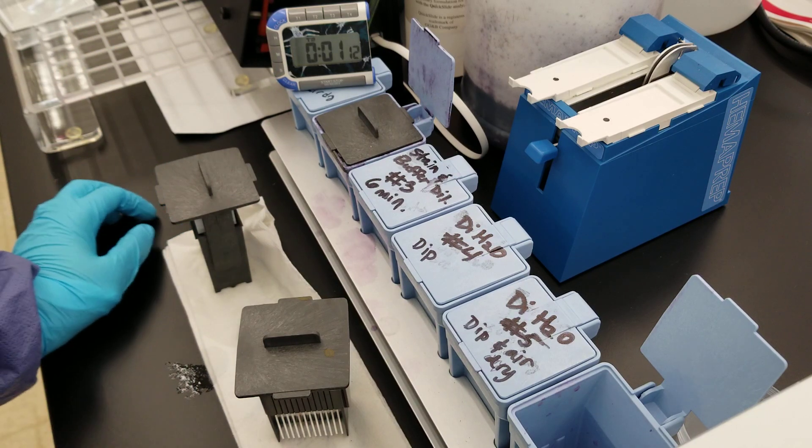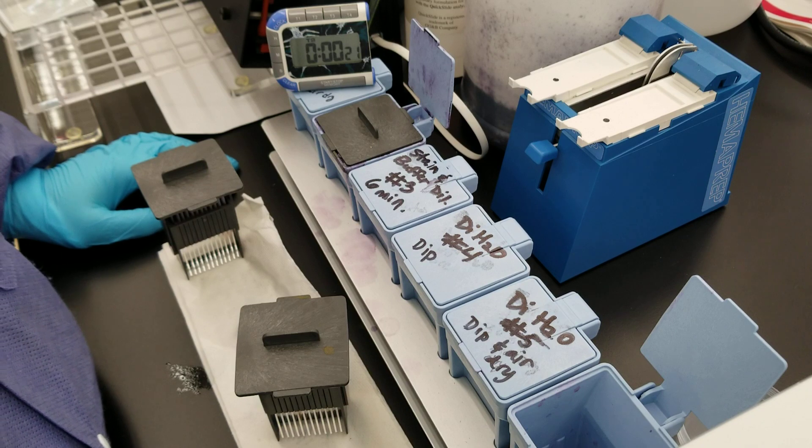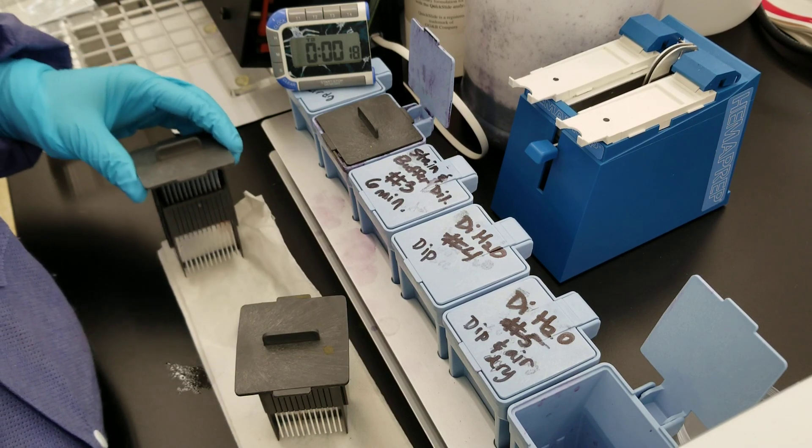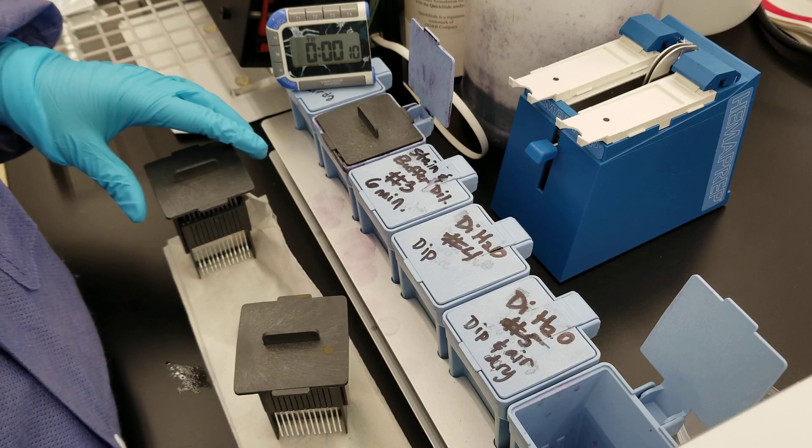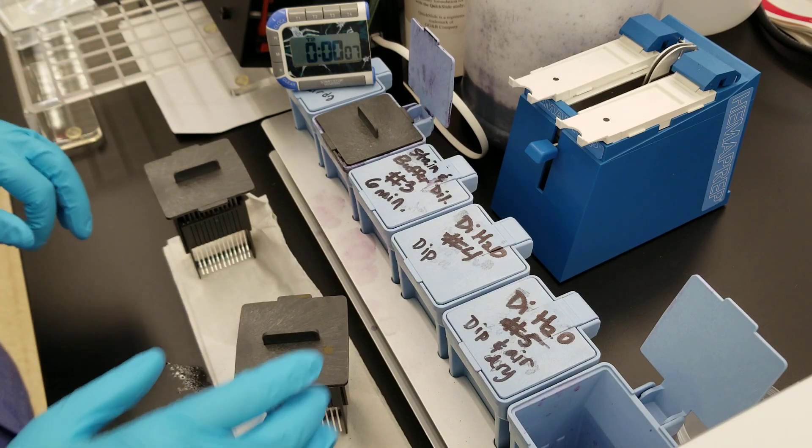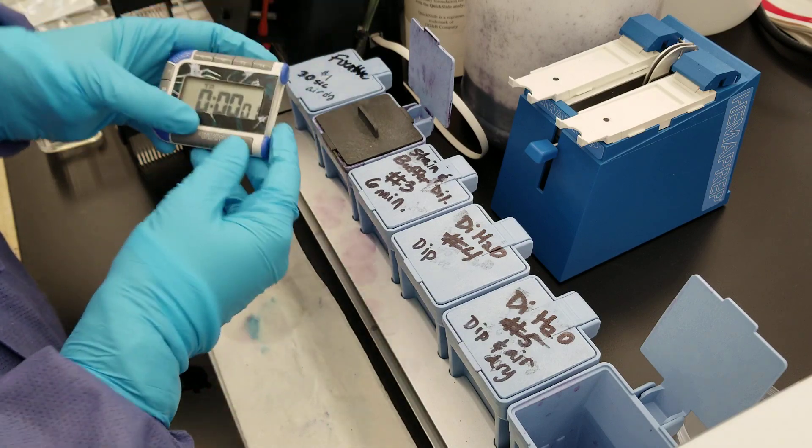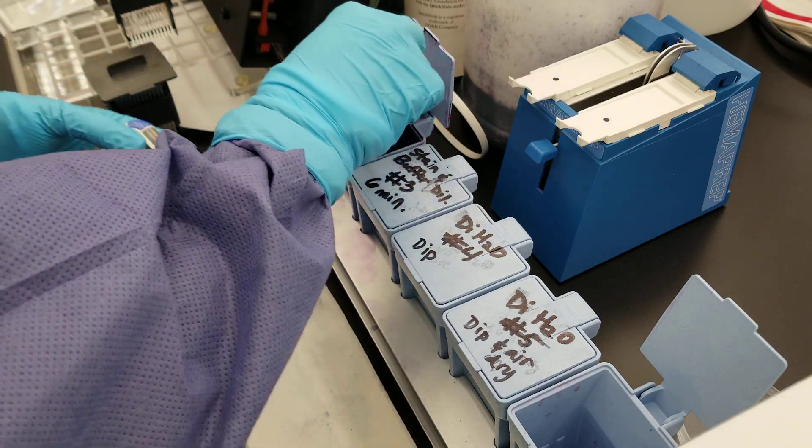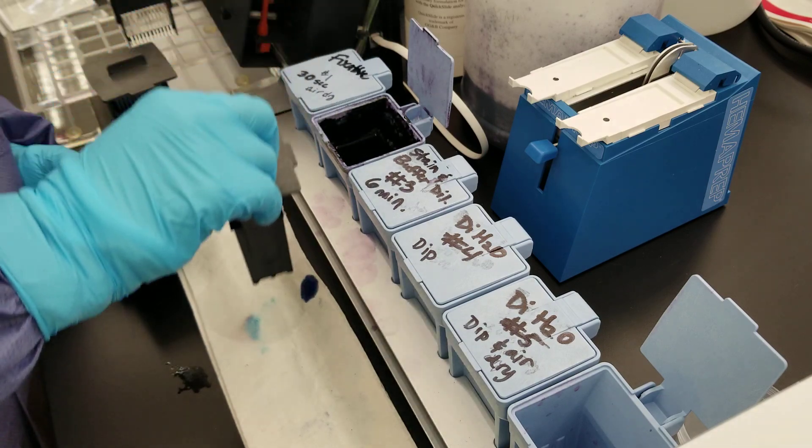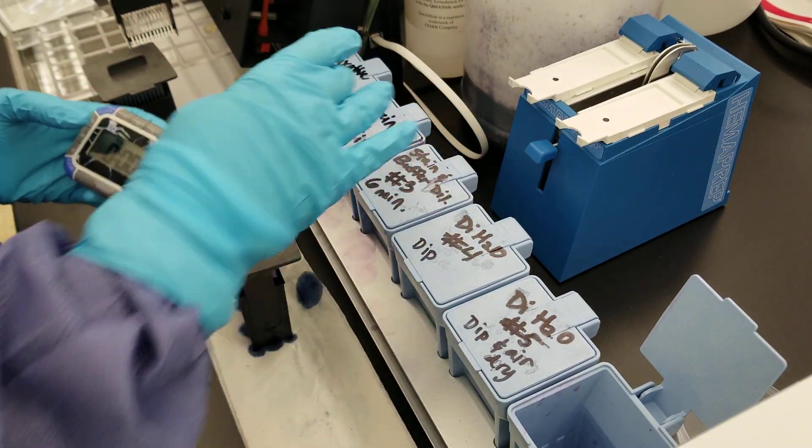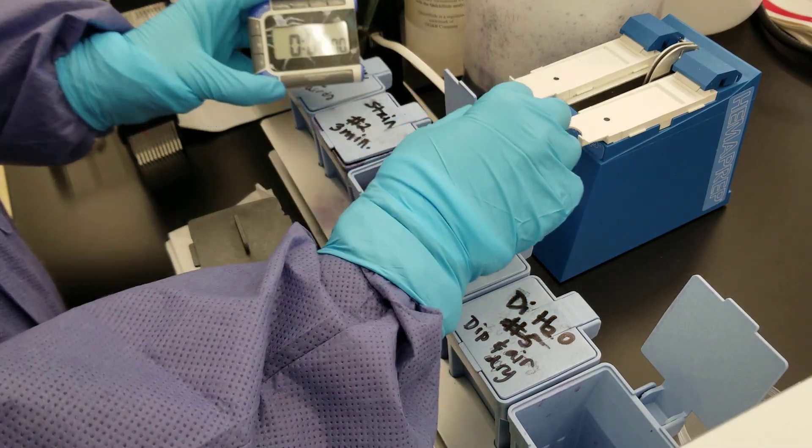We're at the very end here. We've got about 20 seconds more to go. Make sure that you're keeping in mind what batch is what and where it's been. So we're going to pull that out. Very, very, very prominent stain. It ends up staining everything and through everything, so you want to make sure that's not getting on your clothes. We'll put that into here now.